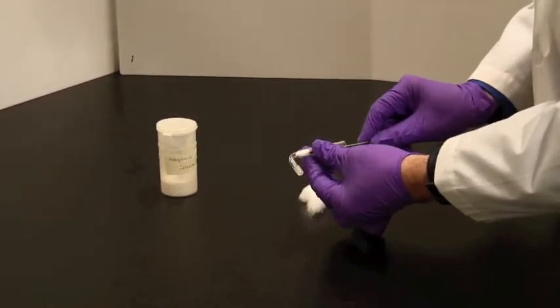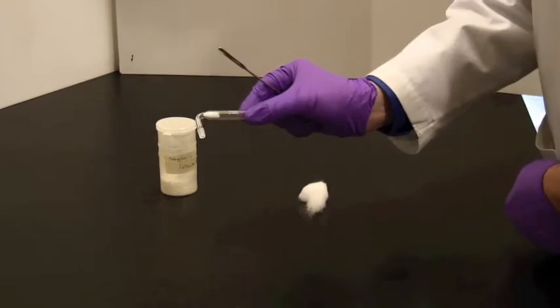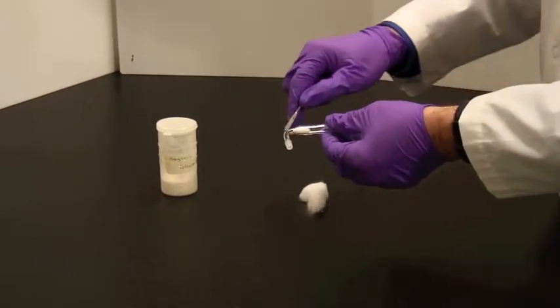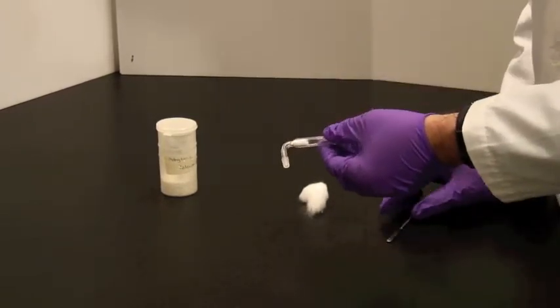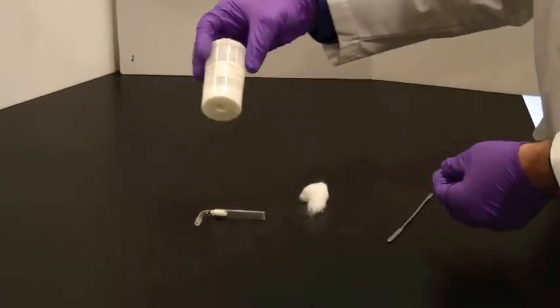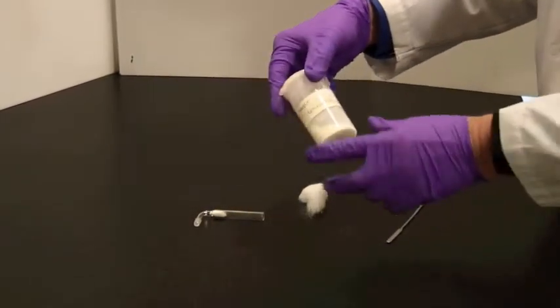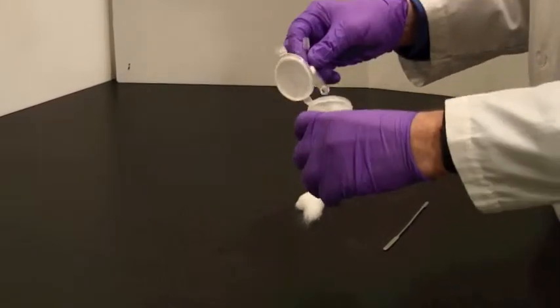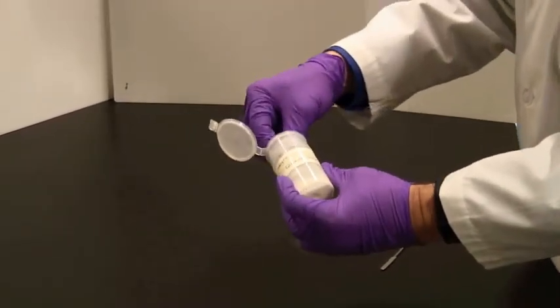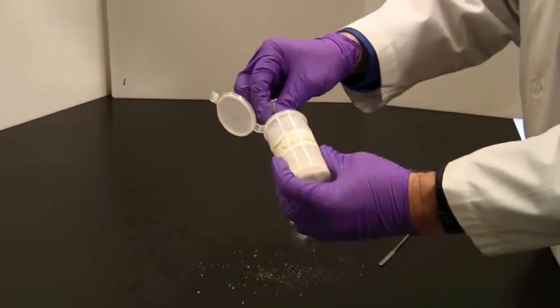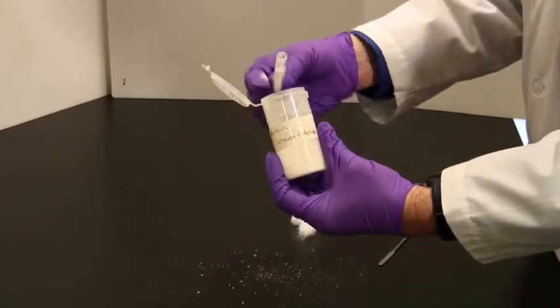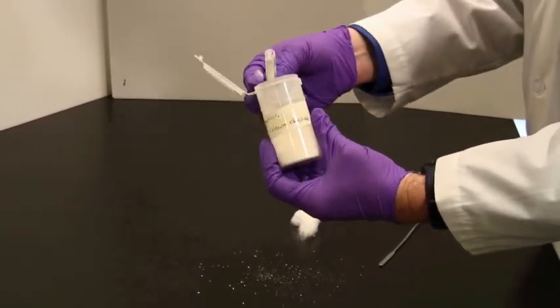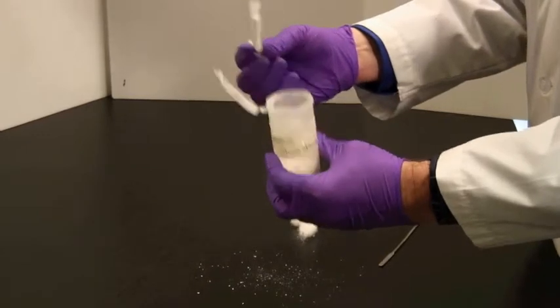Take a little bit of a cotton ball, about a quarter of a cotton ball, and poke that down to the corner of the drying tube. Then take some anhydrous calcium chloride, open the cap here, and using the tube as a scoop, collect some calcium chloride inside the tube itself.